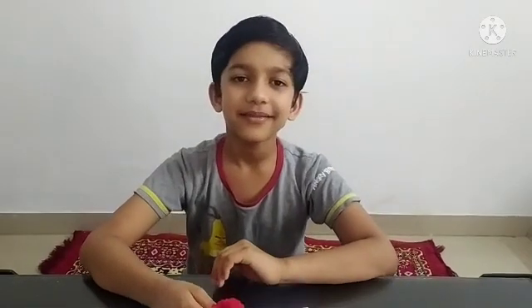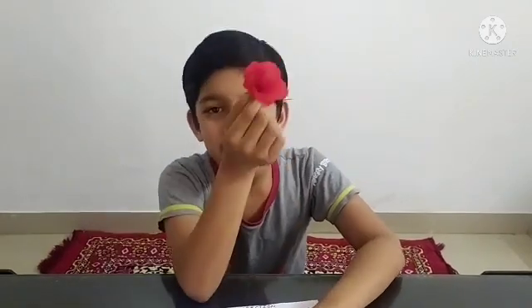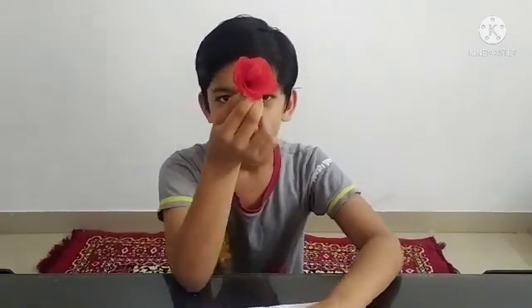Hello everyone, my name is Kitranj and today we will dissect our hibiscus flower. So let's begin.